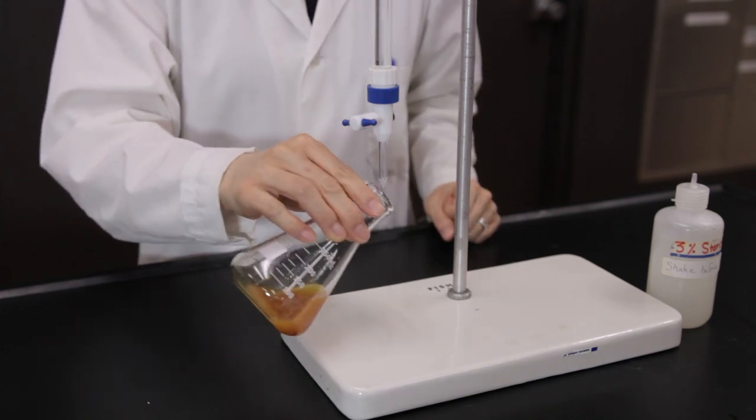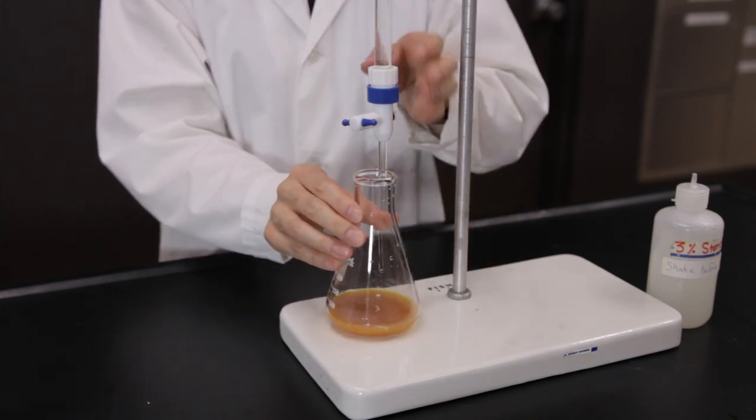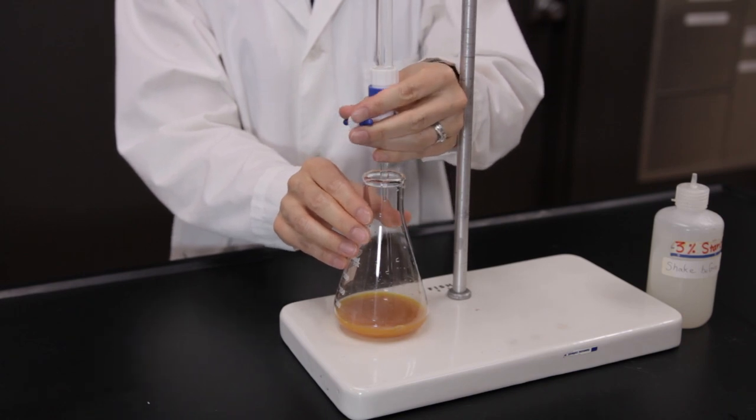Begin titration by allowing a steady flow of drops into the flask. The flask should be swirled continuously.